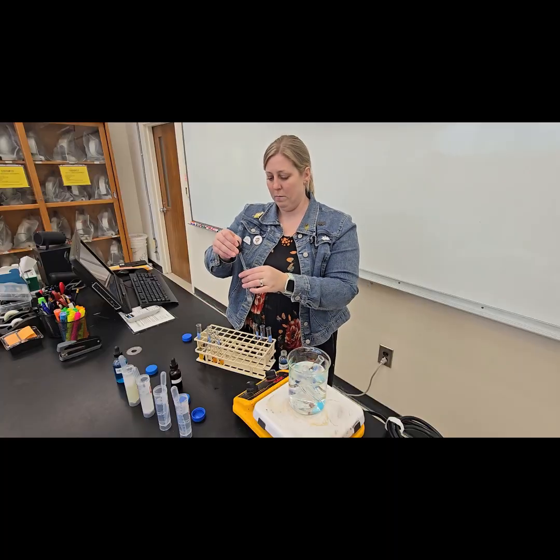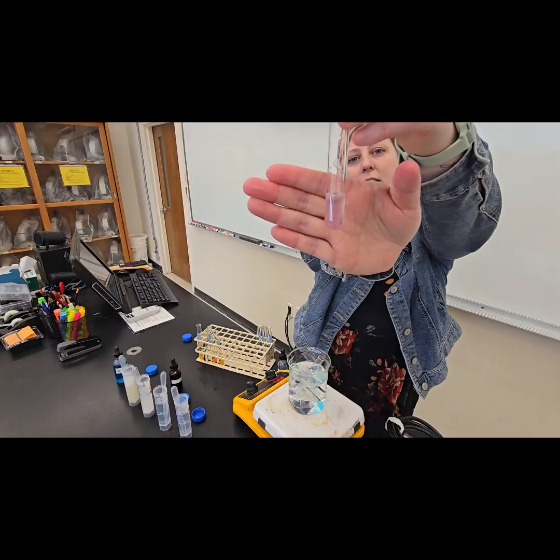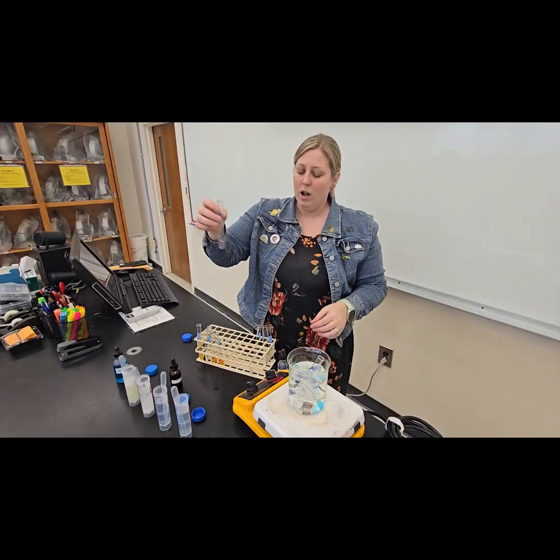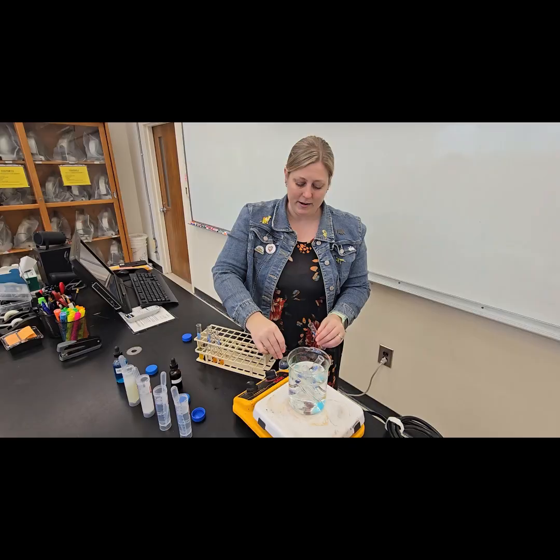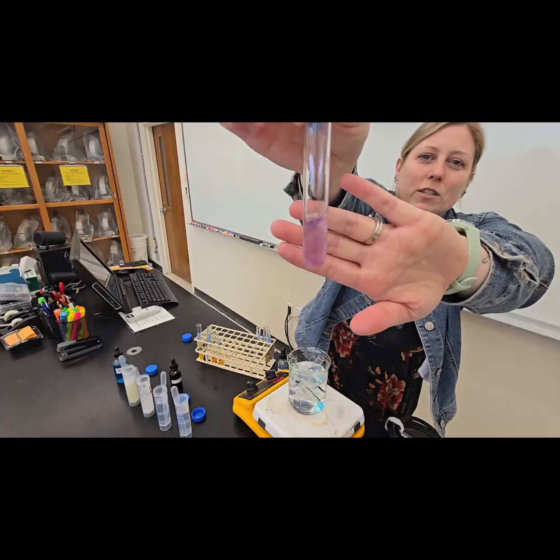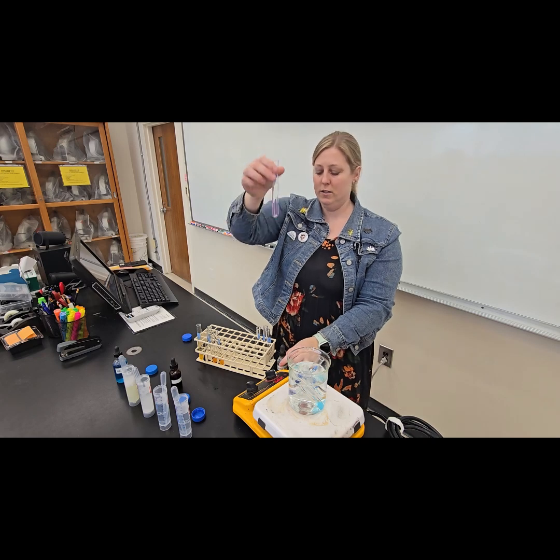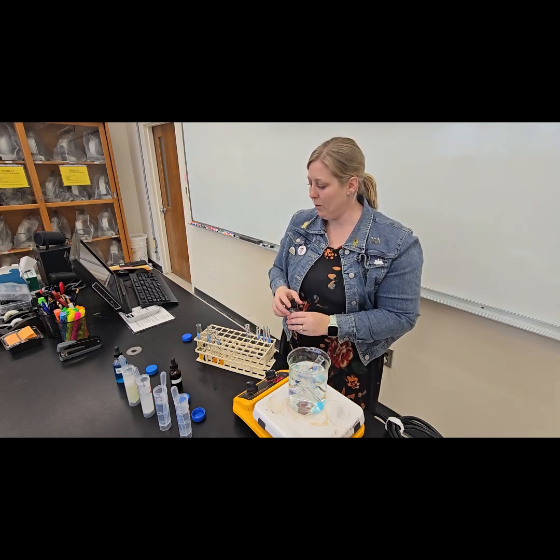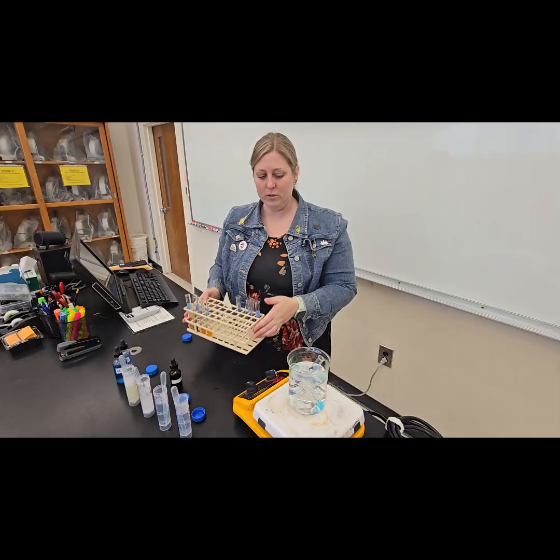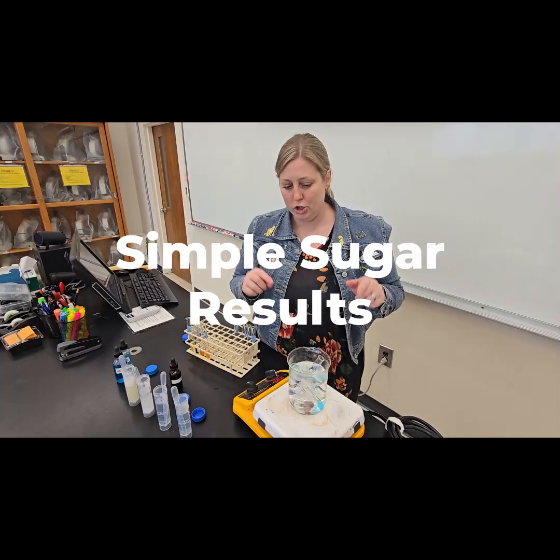And then for my albumin, I should get a color change. And so we should be seeing kind of a light purple color, maybe kind of a pinky lavender color there. If I added a little bit more solution, I might see a slightly stronger response. So sometimes we add some more solution to get a stronger response because it's gonna bind to those peptides, and that's gonna show us a positive result for protein. So at this point, we have now done our positive and negative controls for our starch and our proteins, and it looks like we're getting some color results on our sugars.